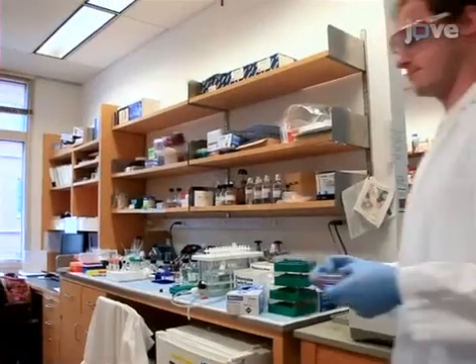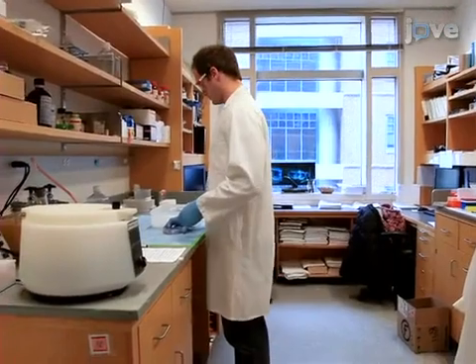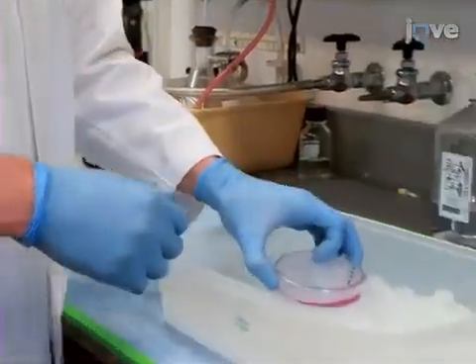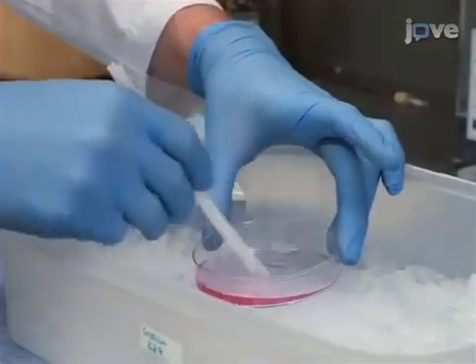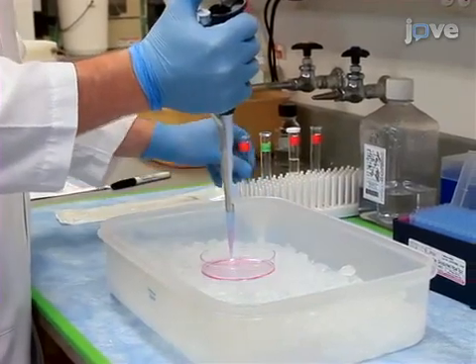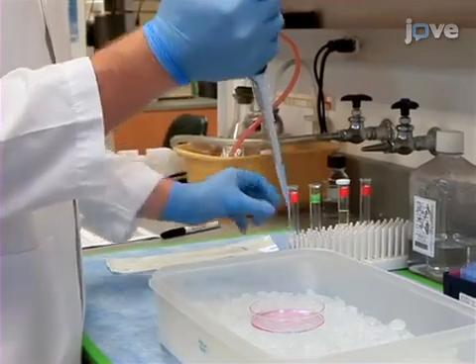For adherent lines, add 1.5 milliliters of media to the cells in a 10-centimeter plate. Place the plate on ice and gently scrape to lift the cells. Transfer the 1.5 milliliters of lifted cell suspension to a pre-labeled 10-milliliter glass centrifuge tube.